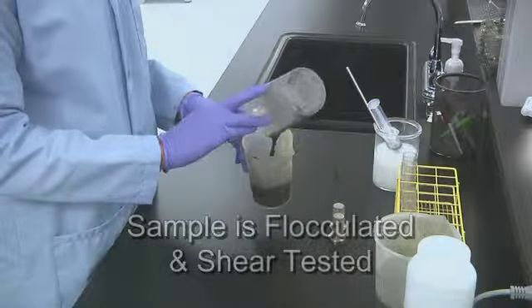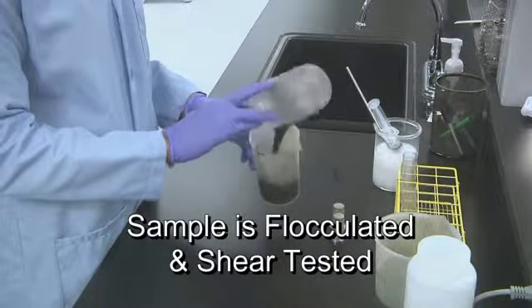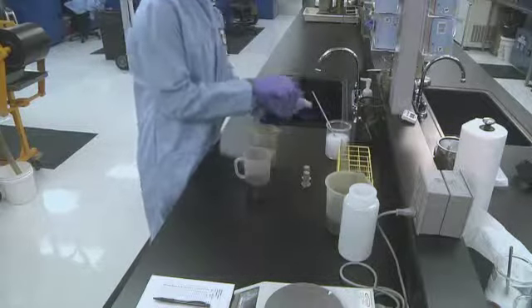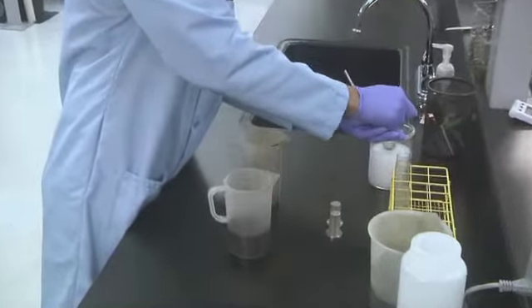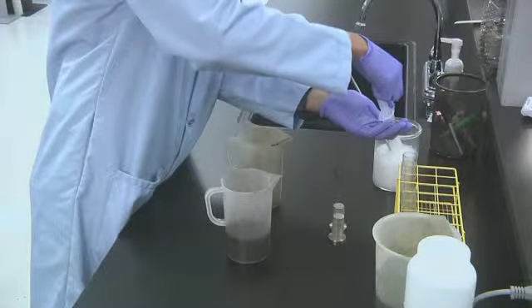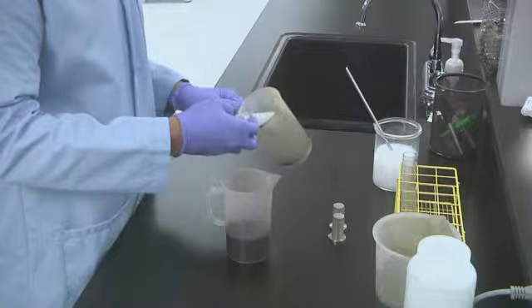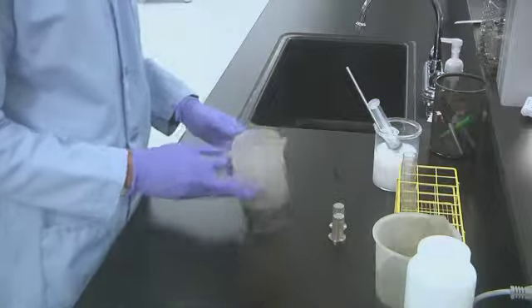The sample is flocculated and shear tested with a 1-liter bottle to determine if the flocculation would withstand the forces entering a decanter centrifuge. Additional polymer may be required beyond jar testing.